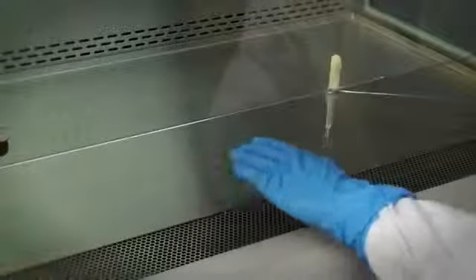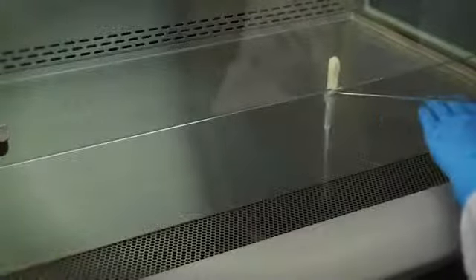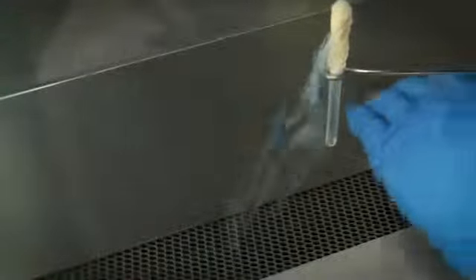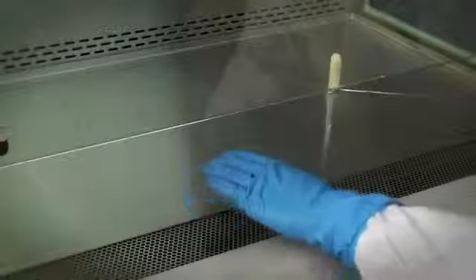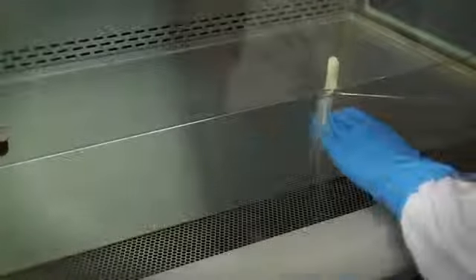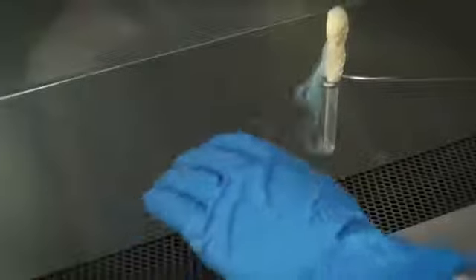The rapid movement of a worker's arms in a sweeping motion into and out of the cabinet will disrupt the air curtain and may compromise the partial barrier containment provided by the BSC. Moving arms in and out slowly, perpendicular to the face opening of the cabinet, will reduce this risk.